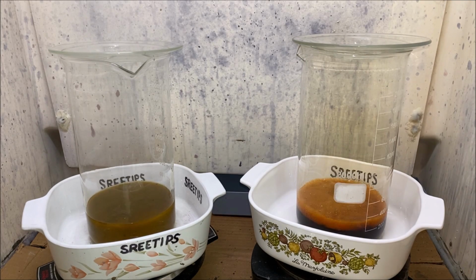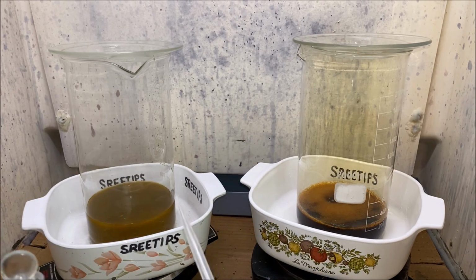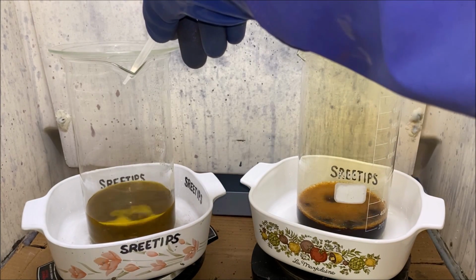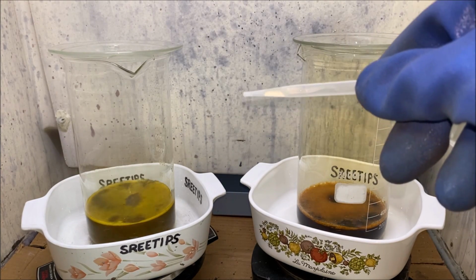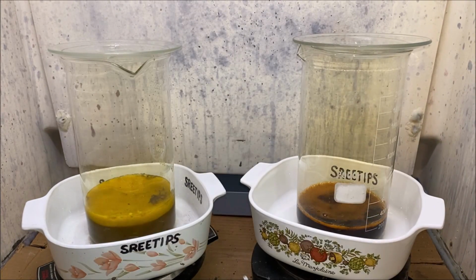Got some distilled water here. If it starts to shoot up towards the top, we can pull the lid off and try to knock it down with some water. Now we'll do the same thing with this solution over here. Just a little bit, just to see if we get any kind of reaction. And this will tell us if we've got all the material in here dissolved. That's about a half a milliliter.